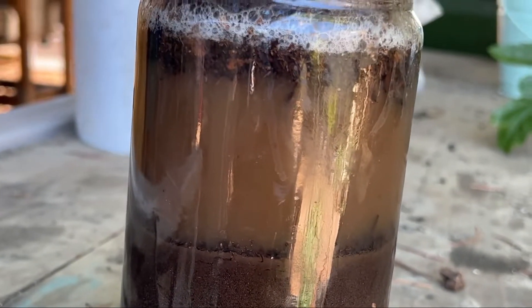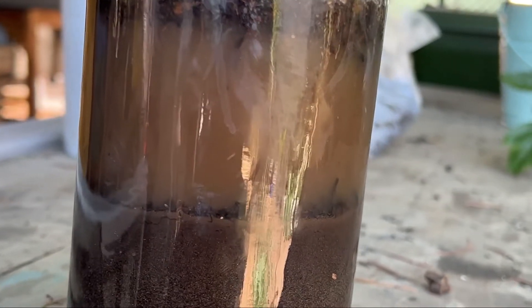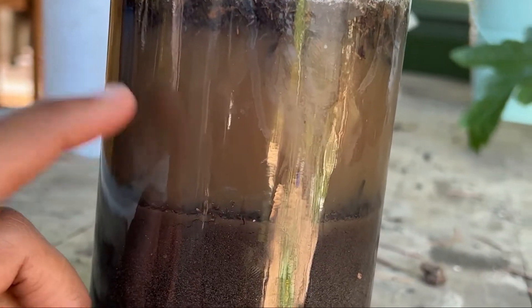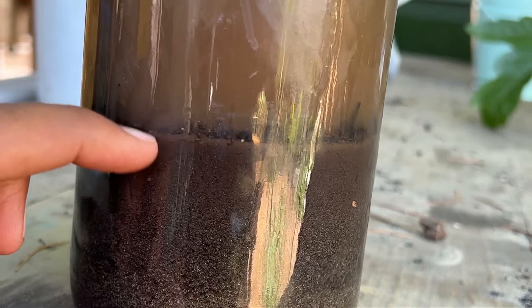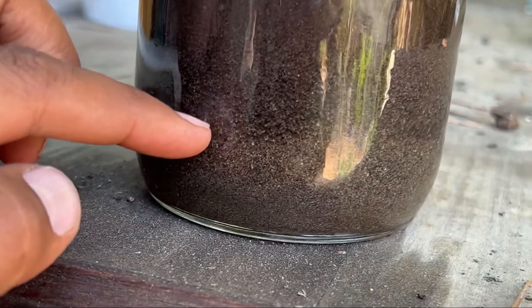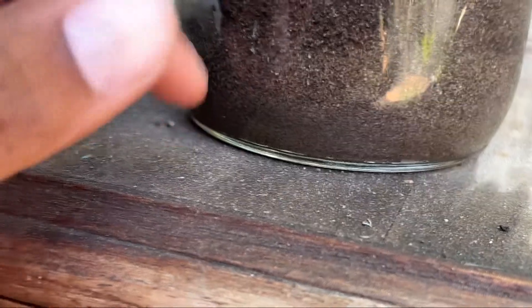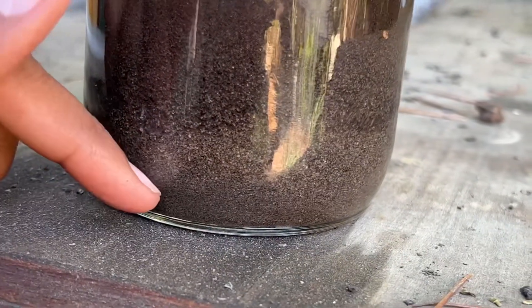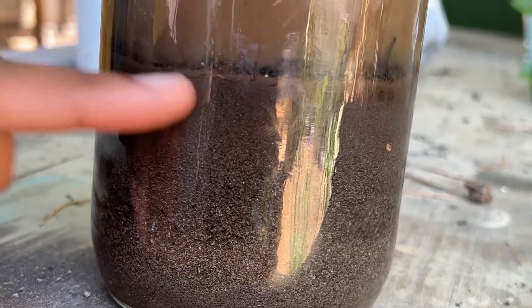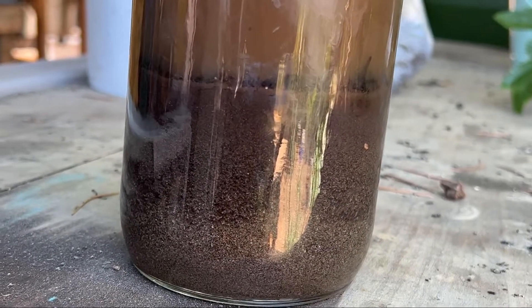It's been about two hours. You can see the water still has plenty of clay suspended up there, so not all the clay has settled out, but you can see a little layer of clay right over here — a very small amount. This is consistent with the soil we have here on our farm. We're in a floodplain of a river, so we should have mostly silty soil, and that is what you see in here. We basically have different types of silt — if we had sand you would see big particles with holes between them, but this is basically all different types of silt. We're like 95% silt, which is consistent with a floodplain.